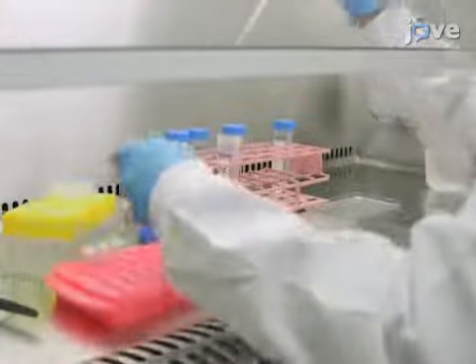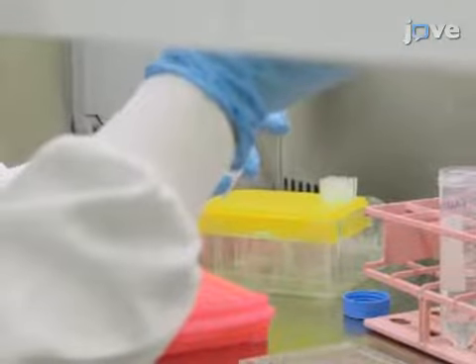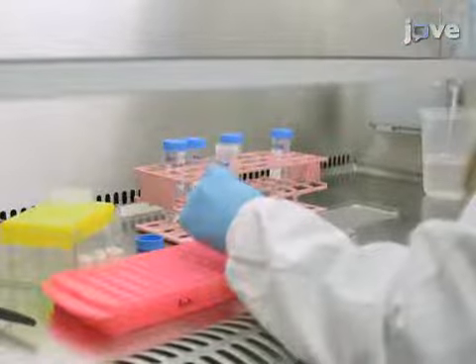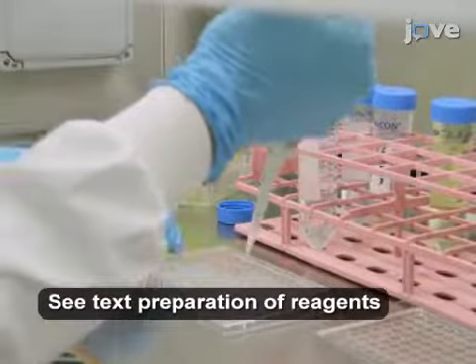Then, pipette 100 microliters of unstained calcein AM labeled or test probe labeled bacteria to each well containing lung tissue. Also, set up controls with lung tissue and 100 microliters of PBS.